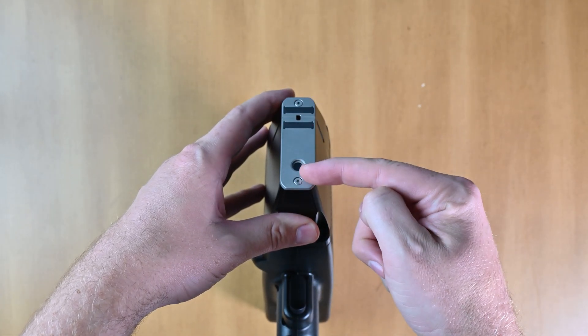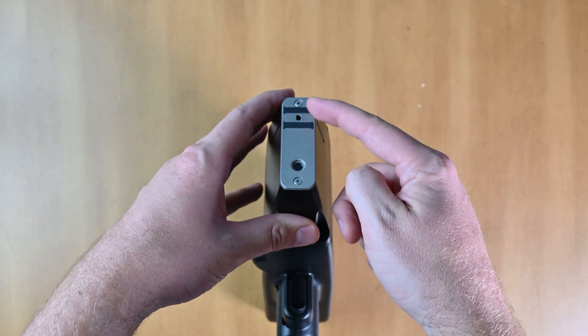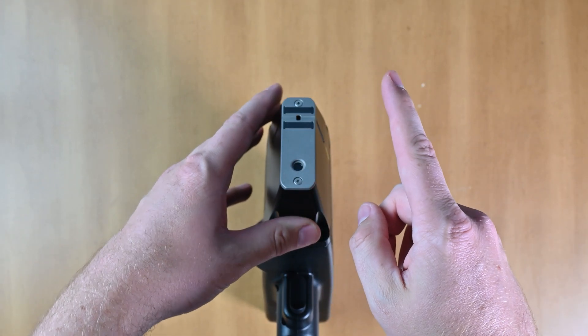And what we're going to need to do is remove these screws in the front faceplate only. Don't remove anything else, just these two.